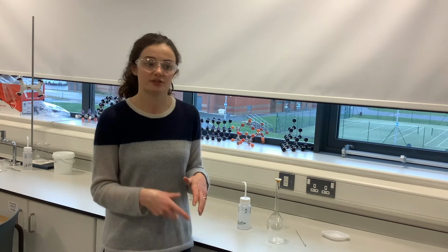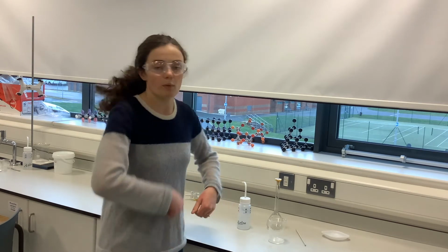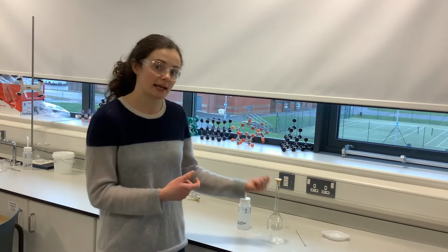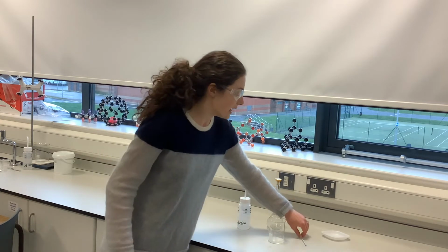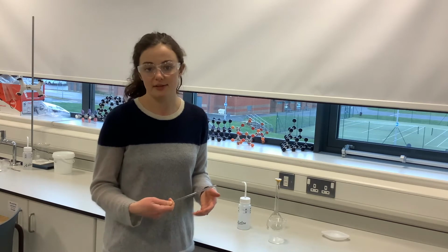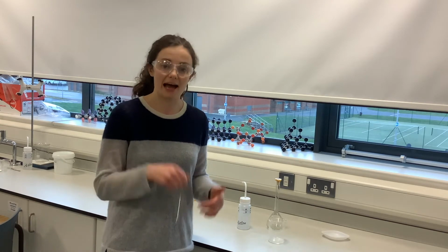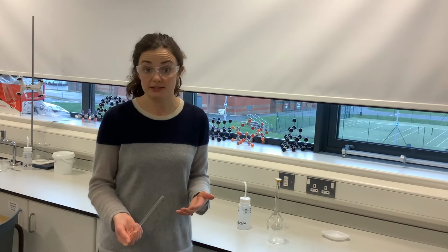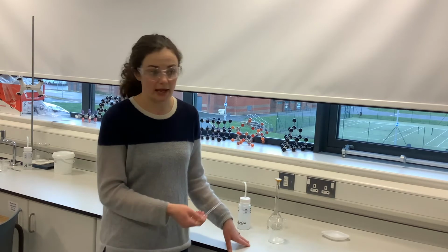We want it to be dissolved before we put it into the volumetric flask, because we won't be getting our glass rod and stirring it in the volumetric flask. We do that in the beaker. So I'm going to do that using my stirring rod, but it's really important that you're accurate when you get to this stage. We don't take our stirring rod out until after we are finished making it up in the beaker and stirring it.